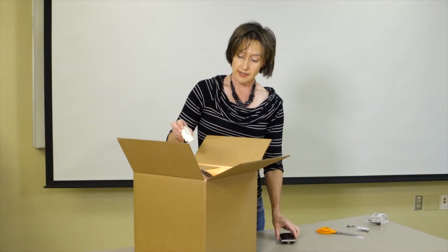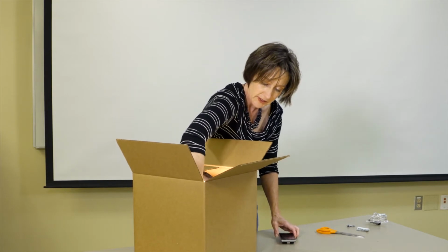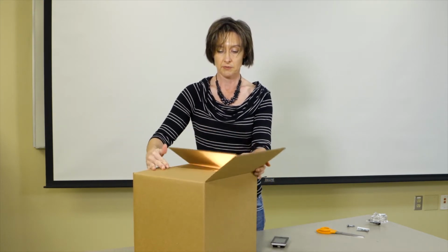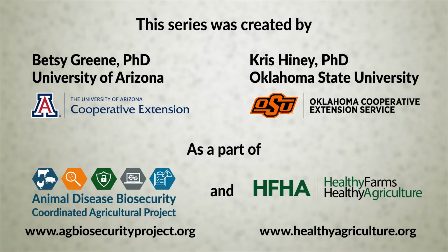So once your light is on, you're just going to add, I use an indoor-outdoor thermometer just so I can tell what temperature is going on in my box. Then we can just lightly close it up, put a little light tape, and when you're ready to get back to it, you'll have an incubator.